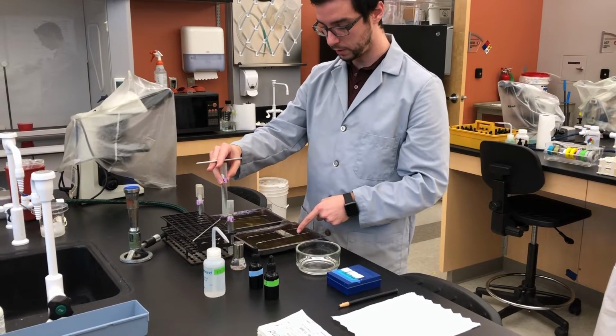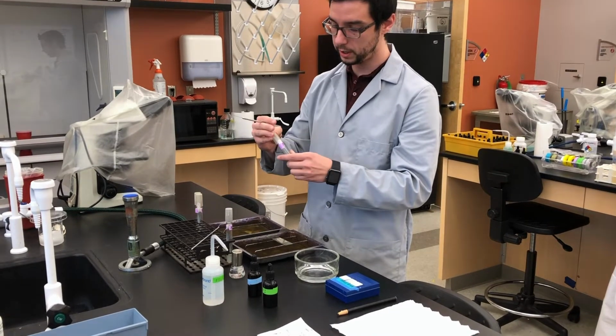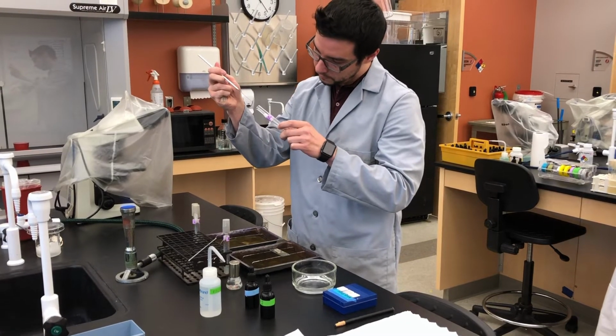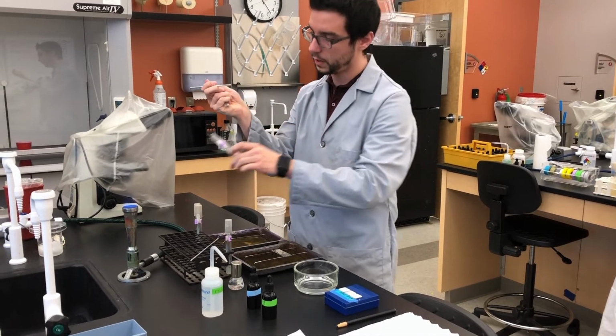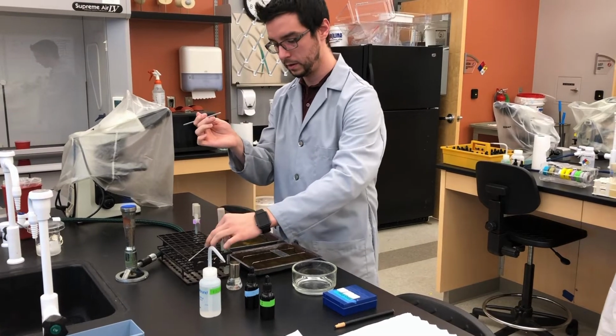Check your label for the side of the slide you're on and the culture you're using. Flame the mouth. Just kiss the edge of that culture. Flame the mouth. Cap.